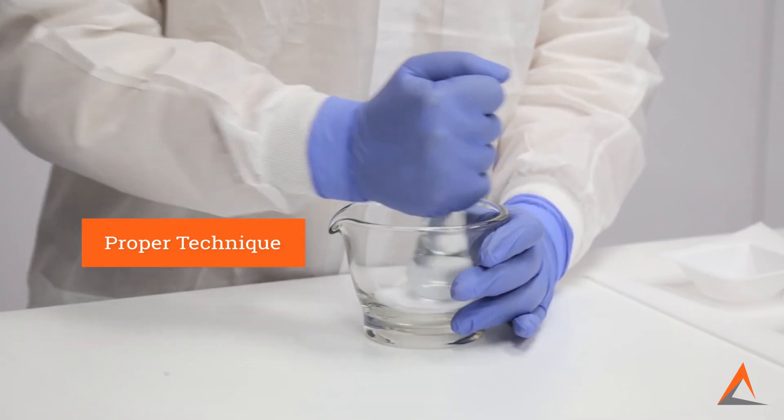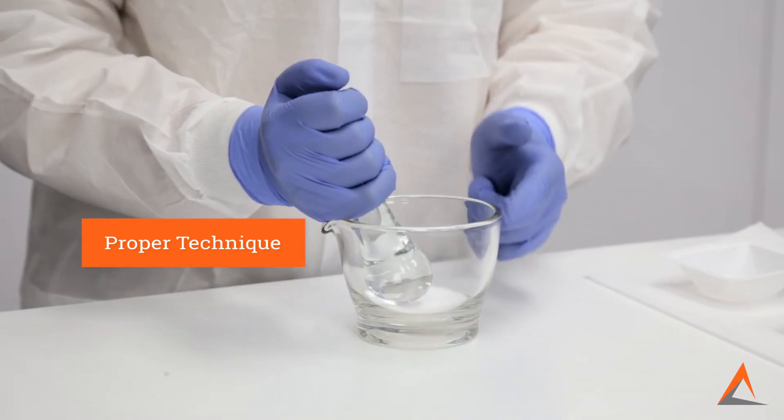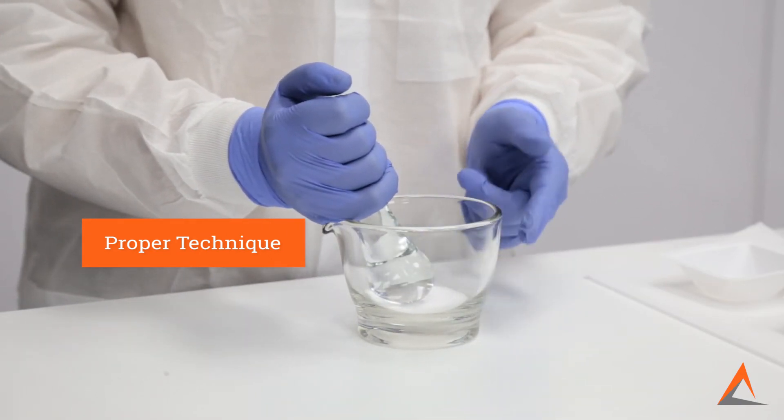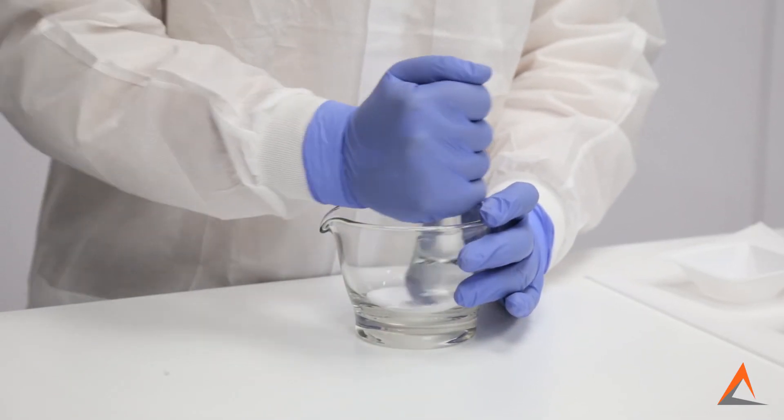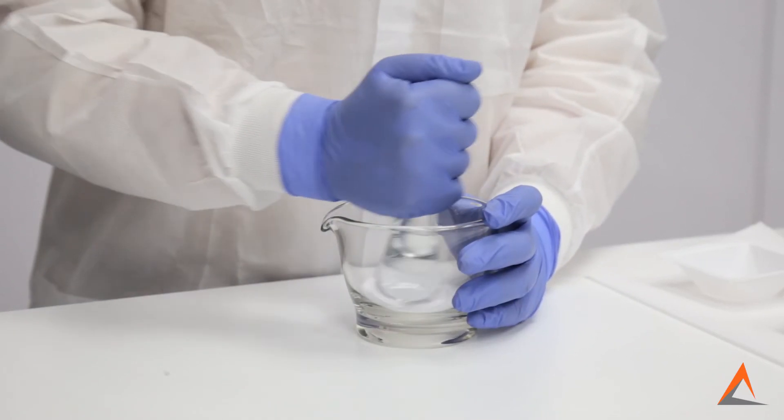Since you are applying a fair amount of force, it's always a good idea to use your other hand to grasp the mortar to hold it in place. This will take some time, but you want to continue mixing and grinding until you end up with a fine, homogenous powder.